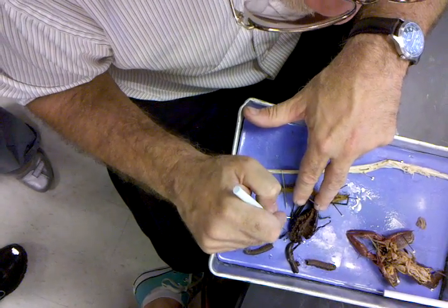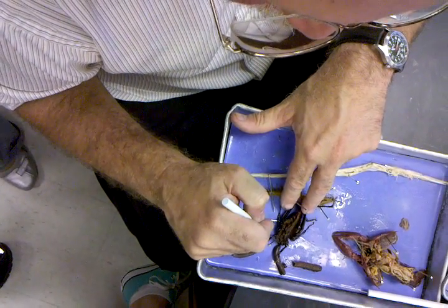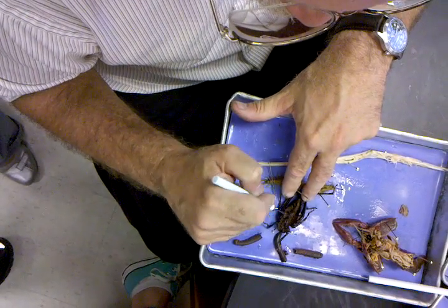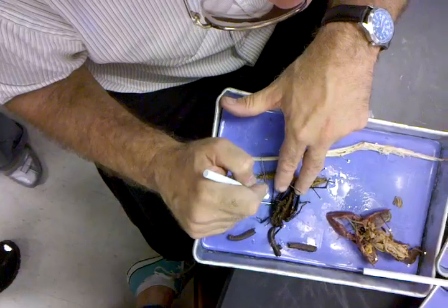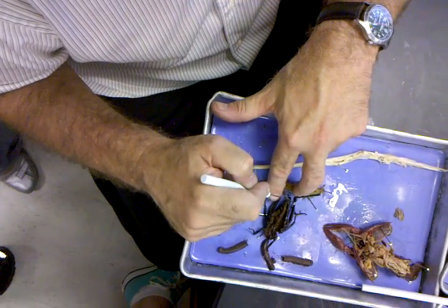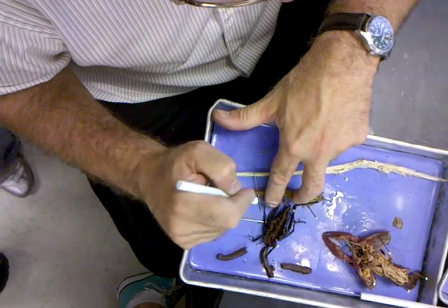So, esophagus would be here. Crop. Gizzard. Stomach. Intestine. And then rectum there.